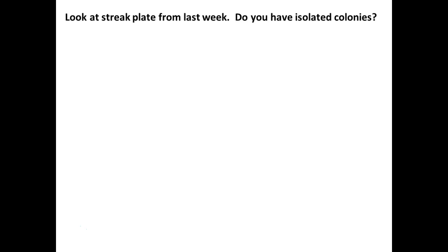Like on today's quiz, there was one plate that I asked you, what do you think went wrong? Any guesses as to what went wrong with that plate? They didn't do the quadrants right. And they didn't take from one section to another. Yeah, it clearly didn't look like they took from one section to another. It looked like they did each one individually. And in fact, that's what they did. They took from the culture and put some in each one of those 4 squares. They didn't follow directions at all.